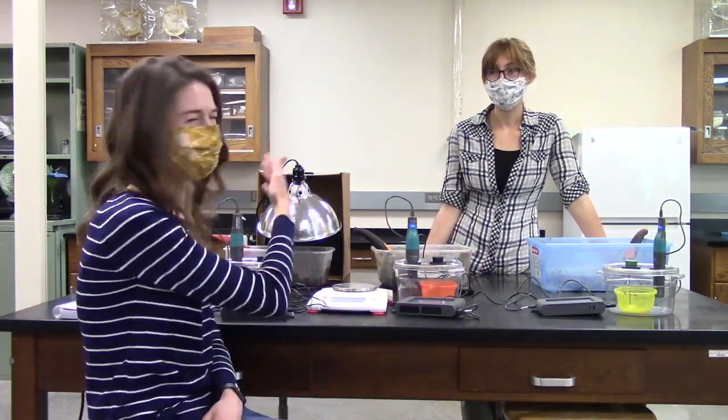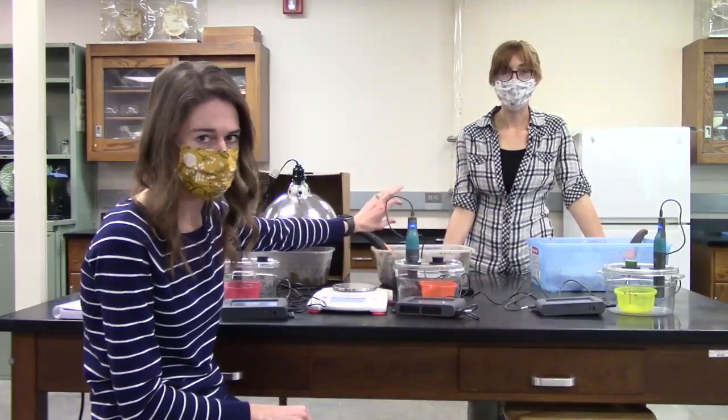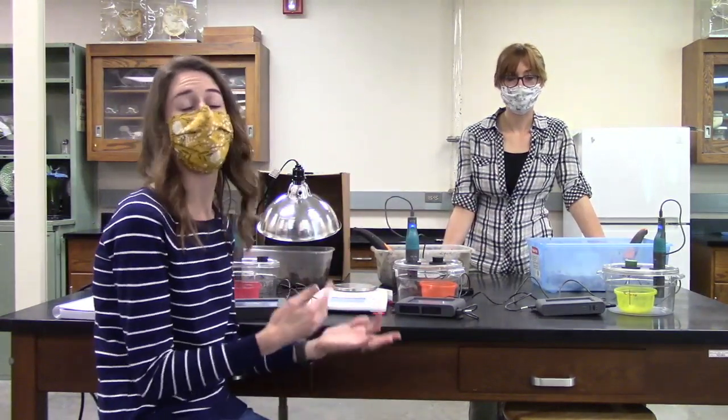So we're using our treatments, temperature and moisture, and we're using them together on the last treatment, but you should be able to tease out the results at the end of this today, because we do have one that is just wet and dry, and then we have one that is heated and wet. If there's a huge jump in CO2 with the heat portion of the experiment, then you might expect temperature has a bigger impact on microorganism activity. If there's not a huge difference between the cool and wet and the warm and wet, then you might say moisture is probably the greatest factor in CO2 production, which means it's the biggest factor in microorganism activity.